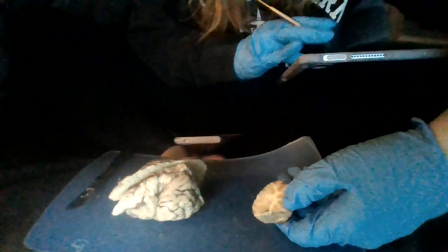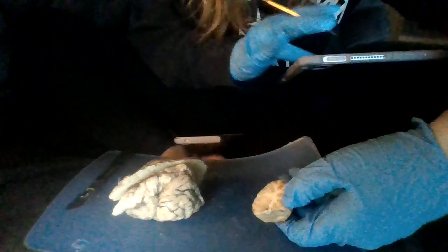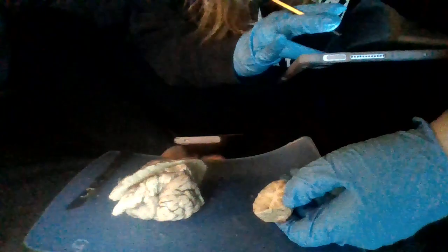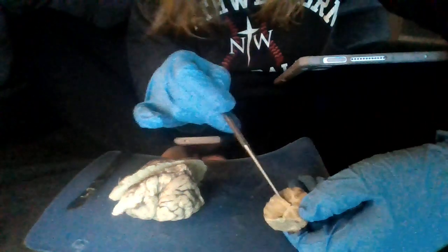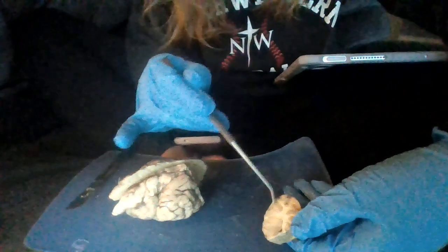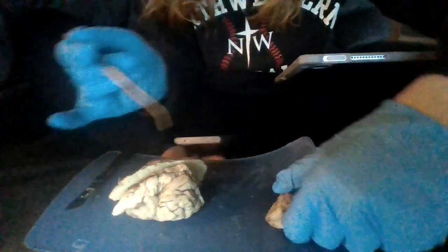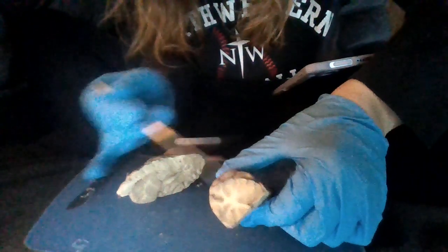Just a couple ways that I remember this by, I have it written down. The white matter is white because of the axons with the myelin on them, which makes it white. And then our gray matter processes and interprets some of our information. And here you can see it on the other side of the brain too, the white matter and then the gray matter.